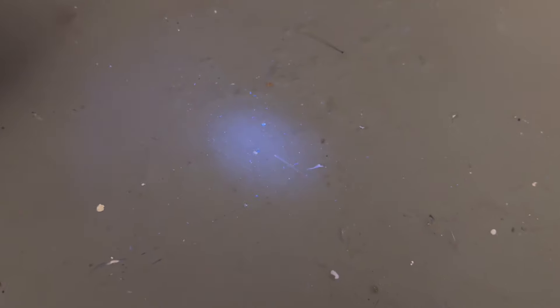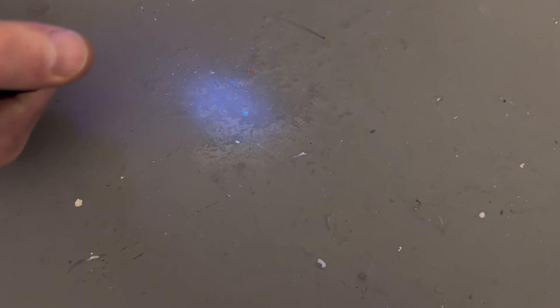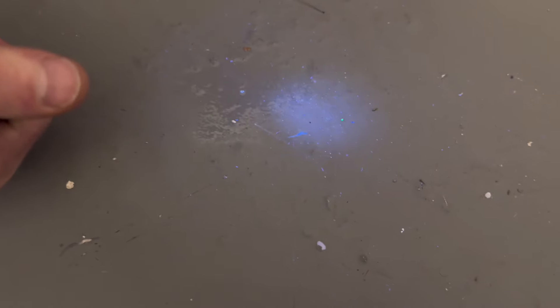So we'll just look at the floor here. Here we see there's no fluorescence of any of the paint on the floor and right there for example, you can see pretty clearly some glowing. We'll do it again over here, see if we get more lead.